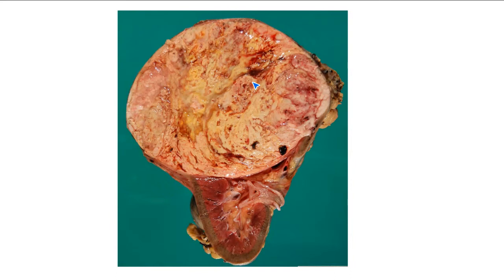However, in medicine there are always exceptions to the rule, and this is one example of a malignant tumor exhibiting this circumscribed appearance. We wouldn't know for certain until we took a section and looked at it under the microscope, but this tumor is in fact malignant.